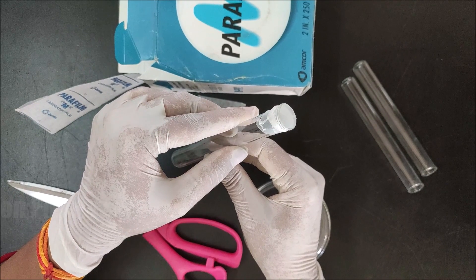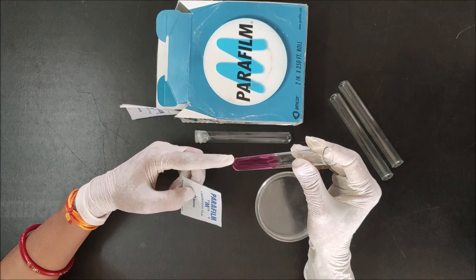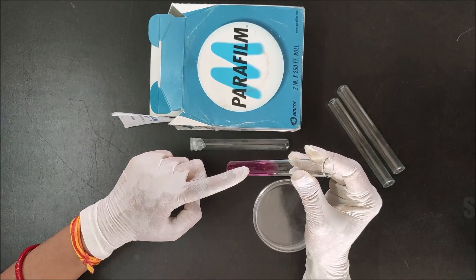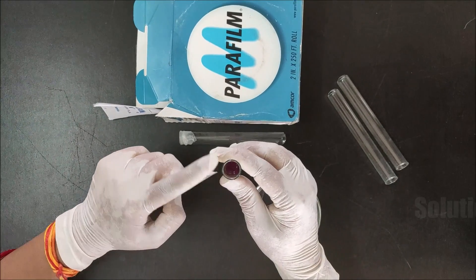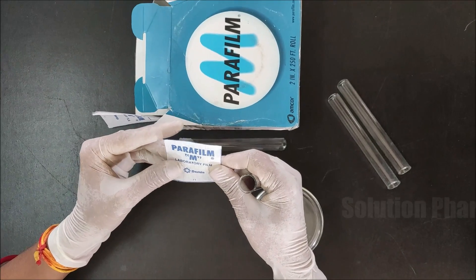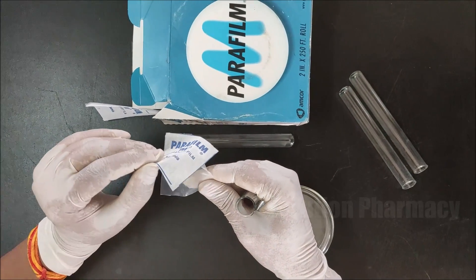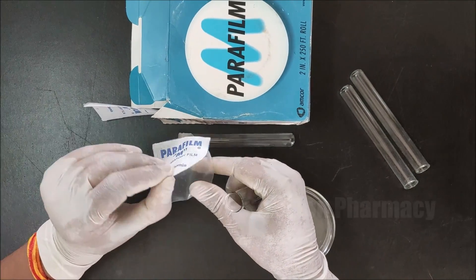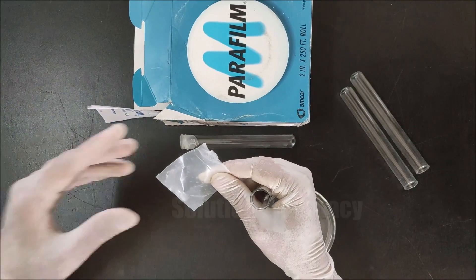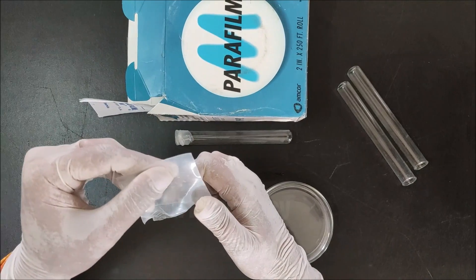For the demo, we have taken colored liquid inside a test tube. We have already cut a small piece of parafilm. Now remove the paper cover from the parafilm, then press one corner of the strip by thumb on the edges of the test tube, and stretch the parafilm to cover the opening of the test tube.